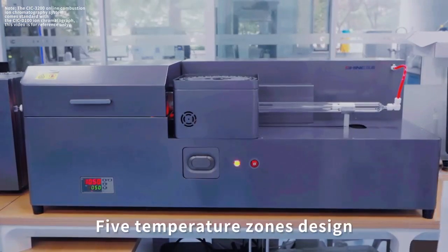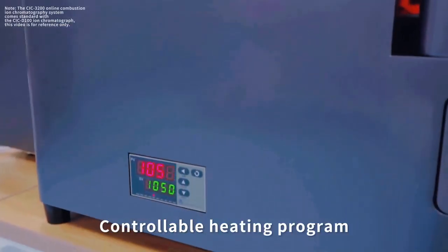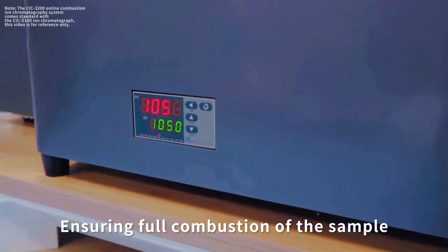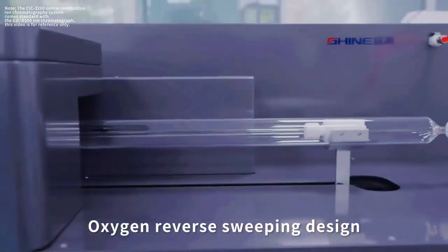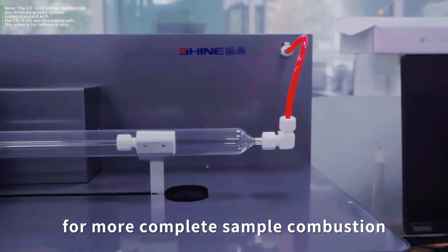Combustion unit: 5 temperature zones design, progressive heating, controllable heating program, ensuring full combustion of the sample. Oxygen reverse sweeping design, for more complete sample combustion.